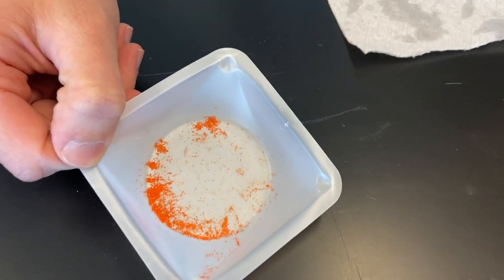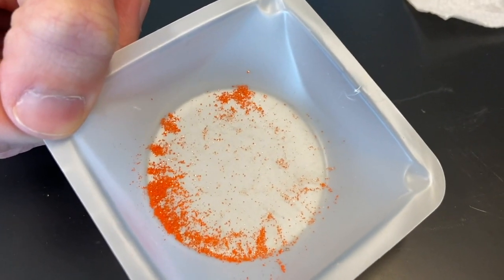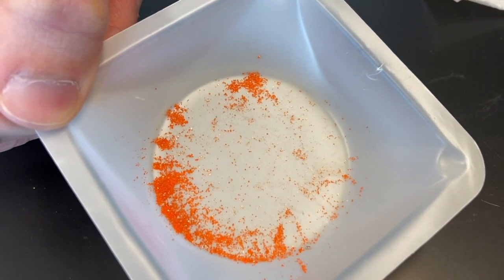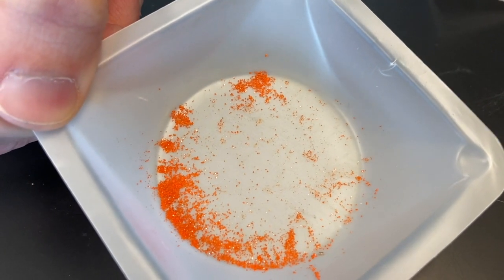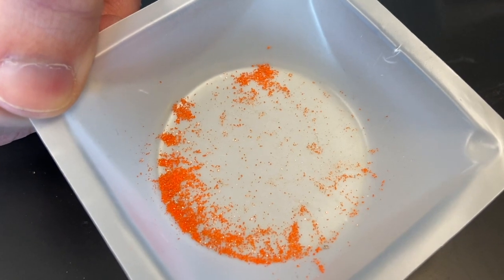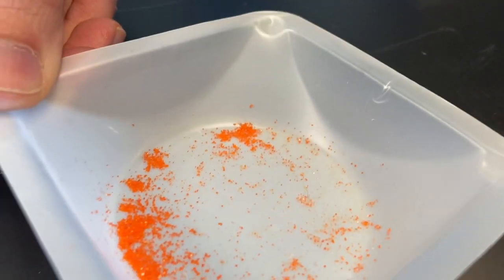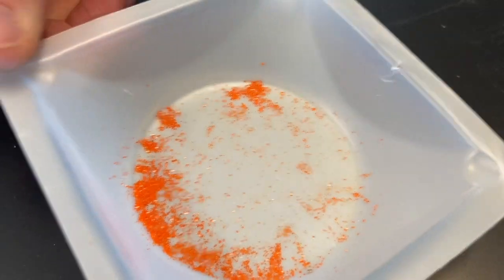Okay, this demo is involving potassium dichromate. This is our first substance here. Make the observations before that you see on it — identify the state of matter, color, and if you can identify texture, that's not a bad thing as well.